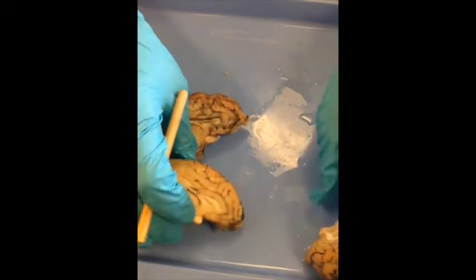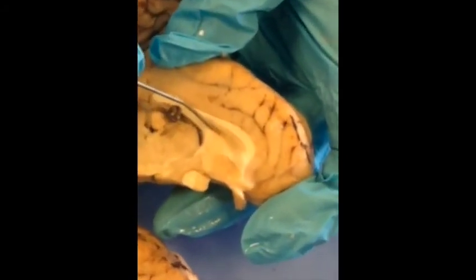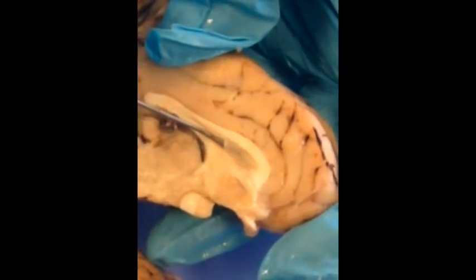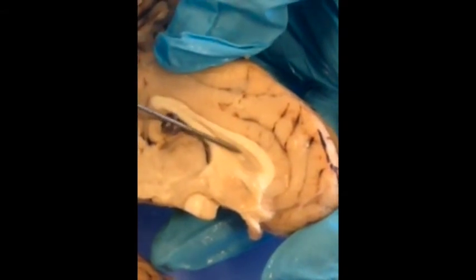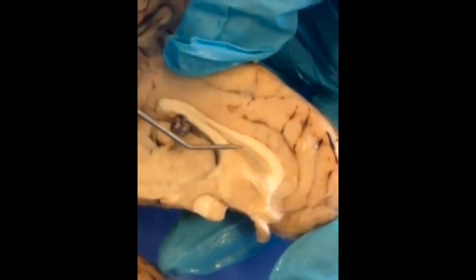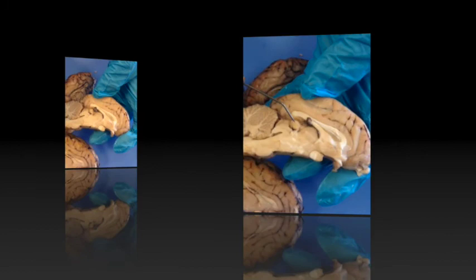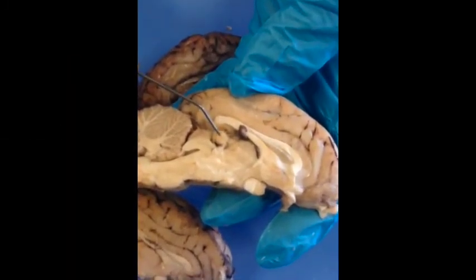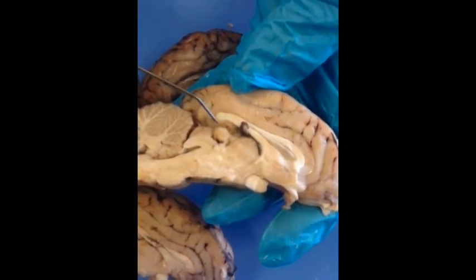This other brain still has the septum pellucidum intact, which is keeping the cerebrospinal fluid in the lateral ventricles. If the septum is still there, you would identify it as the septum pellucidum. If it's open and identified on the test, you would want to say lateral ventricle. One thing we forgot to show you was the pineal gland — here it is, right next to the thalamus. Don't forget that on the test.